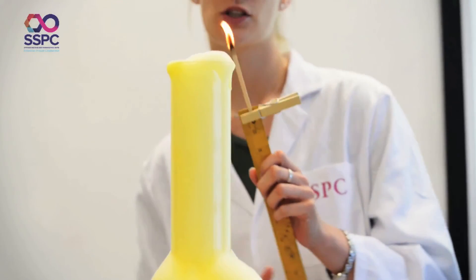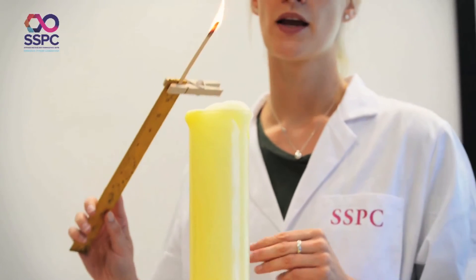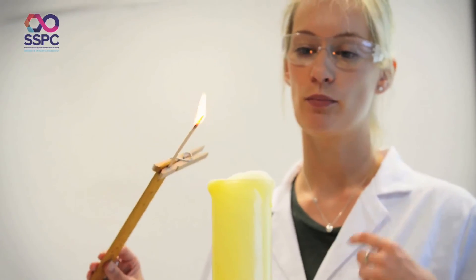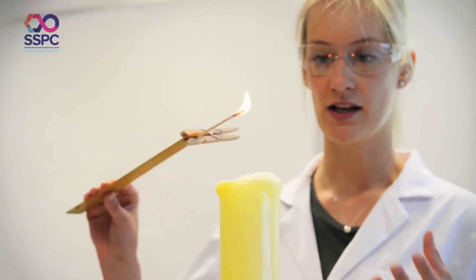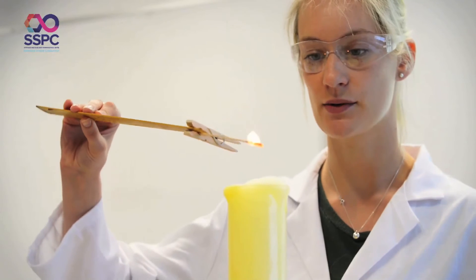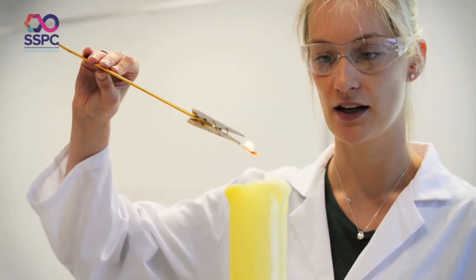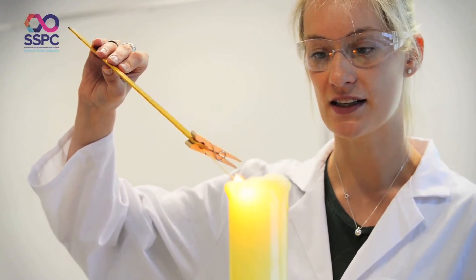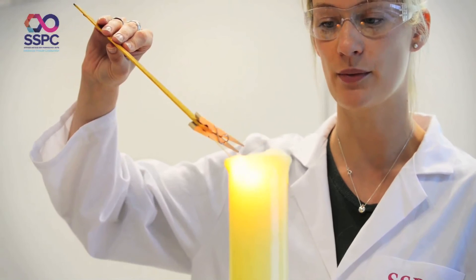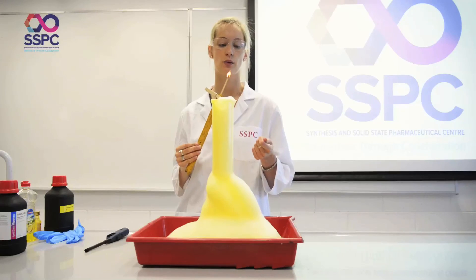The characteristic test for oxygen is to show that a flame will burn brighter in it, or to relight a glowing splint. As I touch this into the bubbles you can see that the flame glows that bit brighter and we can show that oxygen is present.